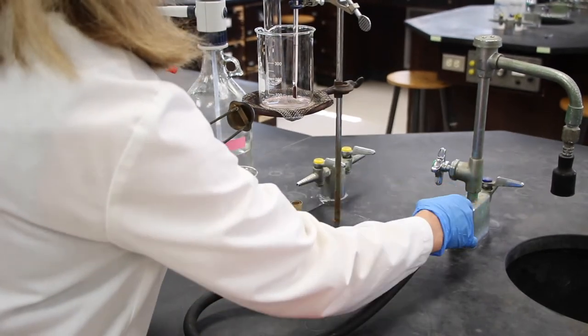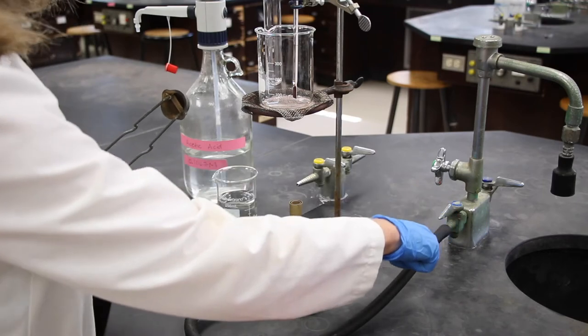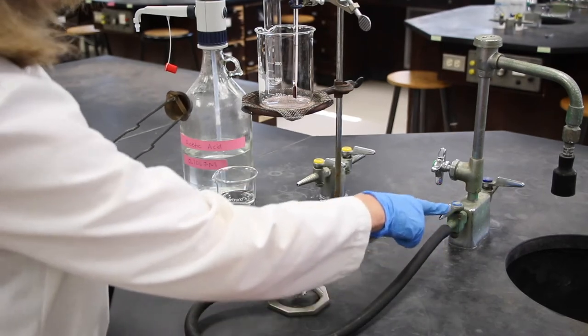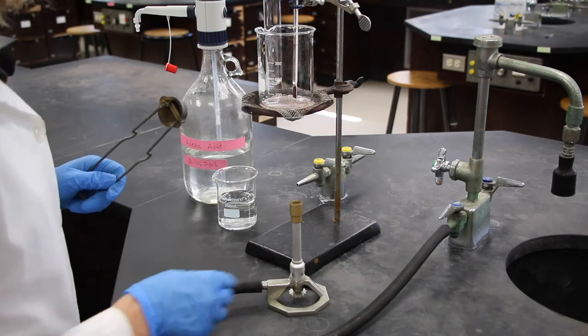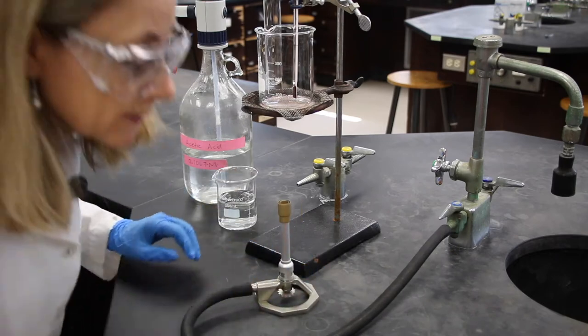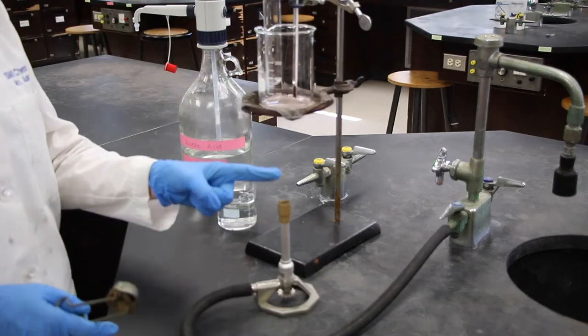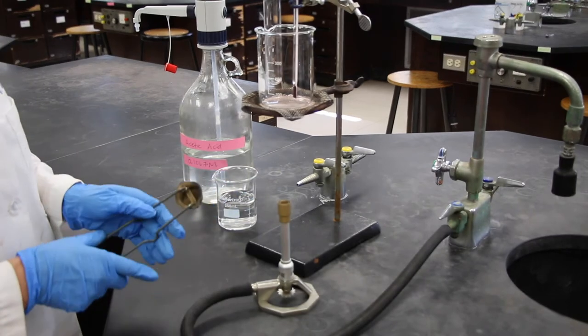We'll turn the gas on, and you want it completely parallel with the nozzle here. And sometimes I'll listen for it, and I can hear that there is gas flow there.